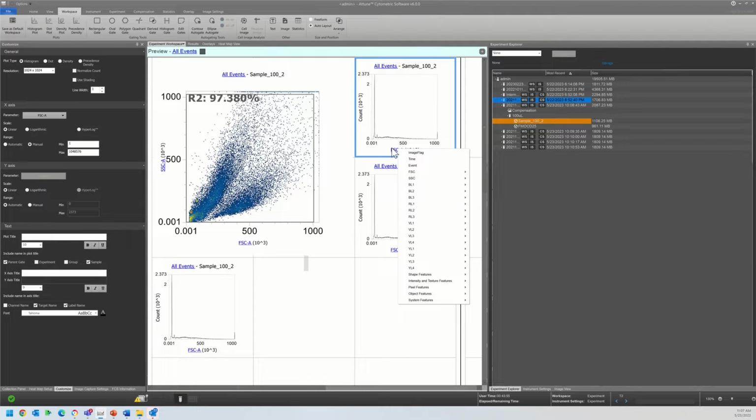So once the sample's been processed, we get these 5 separate categories of extended parameters. We have our shape, intensity, pixel, object feature. This is our particle count, or this will be our singlet count, and our system features. These are going to help us with the quality control steps.